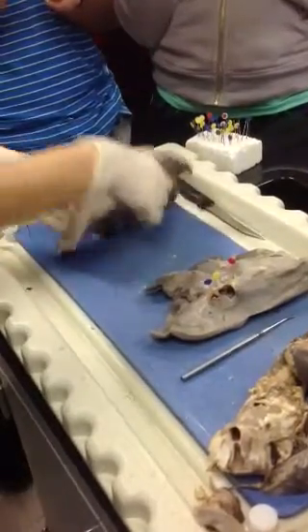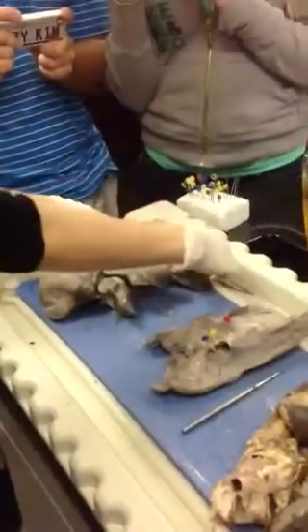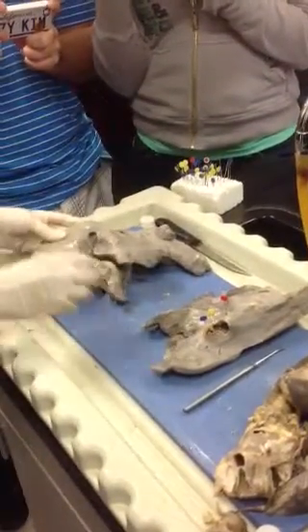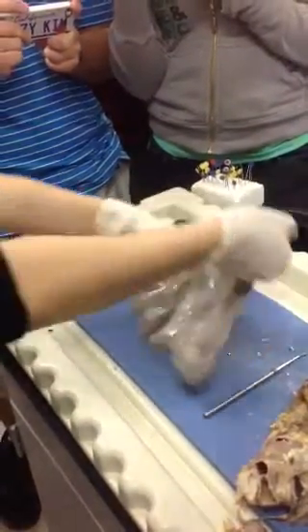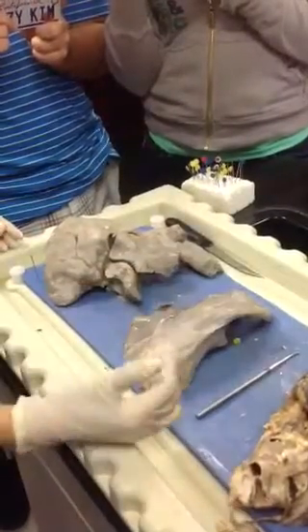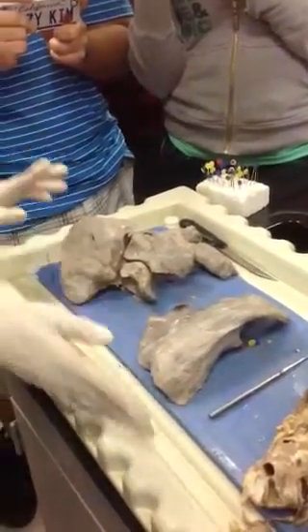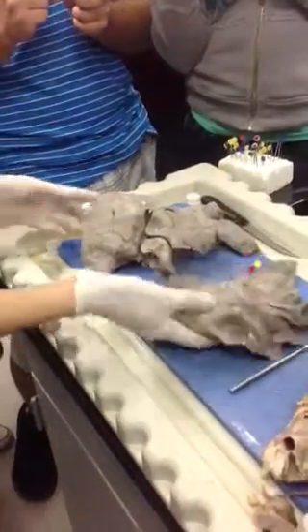Now, if we flip it over, you can also see that. It might be a little bit more clear, actually. Smaller, larger. So we have the right superior, right middle, right inferior. Okay? And then same with here. Smaller lobe, larger lobe. Left superior, and left inferior. Always determine left versus right. Okay? Alright, so I'll leave this out for you guys to take a look at.